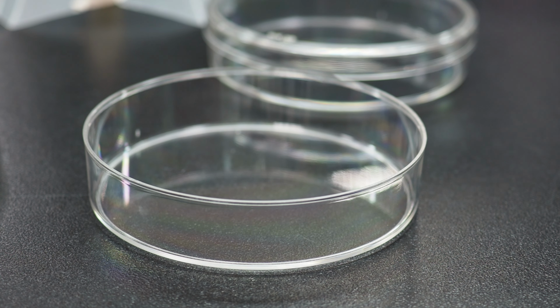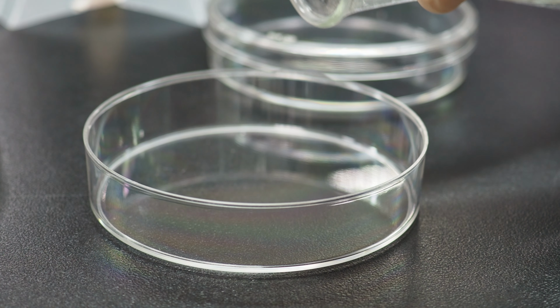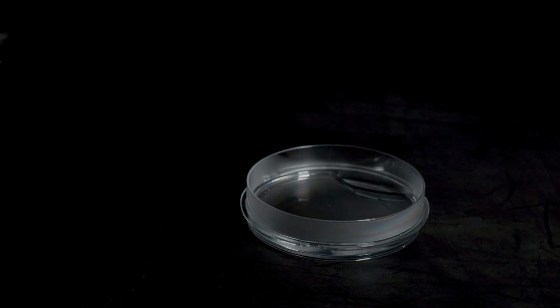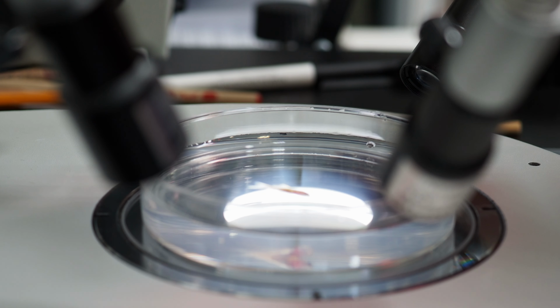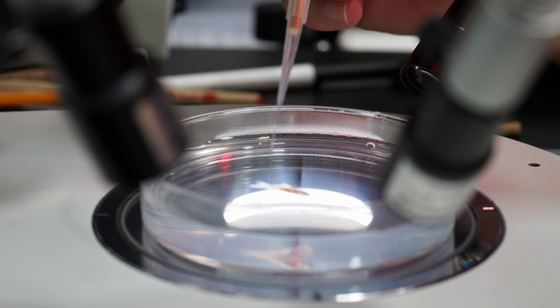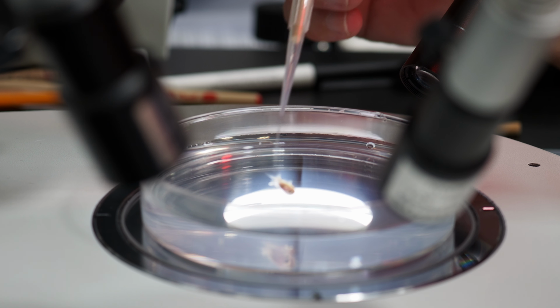Depending on their size, the fish are placed directly on plastic dishes or on plastic dishes lined with agarose for photography. At this time, we use agarose-lined dishes with V-shaped grooves in the center. This allows us to freely adjust the angle of the fish for photography and to gently move the fish to a desired position using a handling stick.